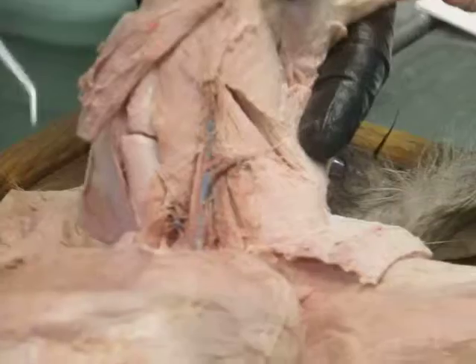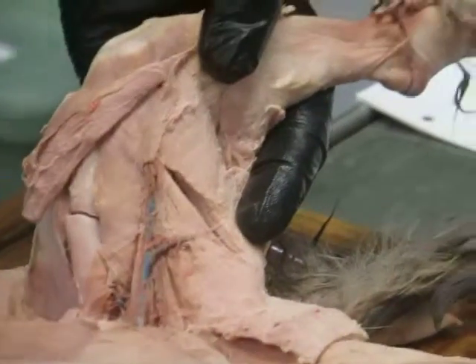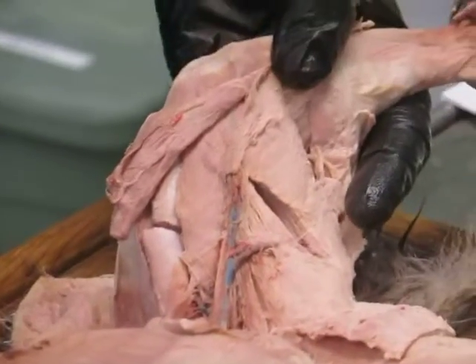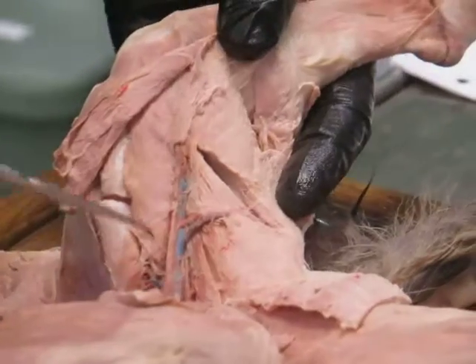Okay. Did you see okay, Kevin? I see you sort of. Could you please see the caudal, which one are you on? Oh, I'll come to the caudofemoralis. Okay, I sort of left that out for now. We're back on the medial surface.